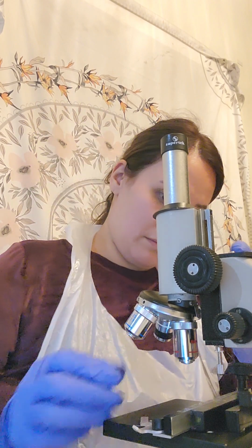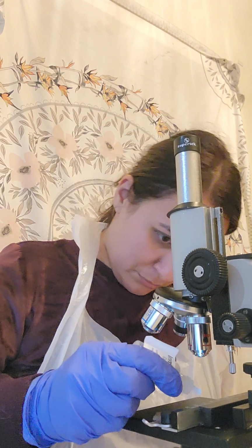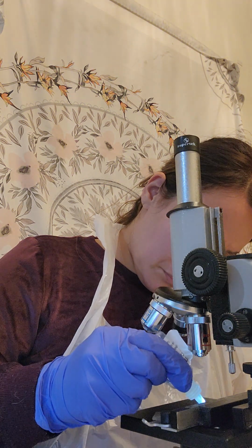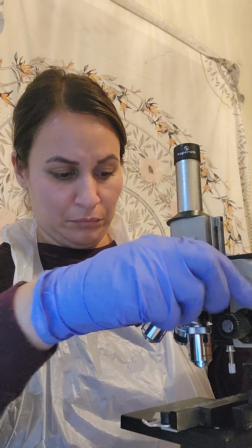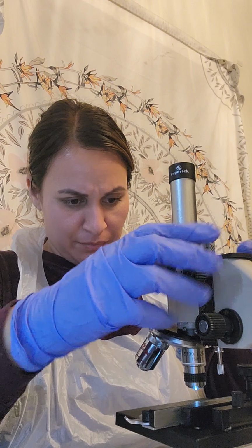Okay, here we go. Let me add the oil. Turning this.